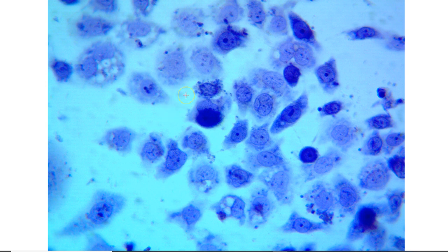Here's another similar slide that contains a different cell line and was treated with some particular drug, and you can see all different types of things happening in this one as well. So you see some cells, these are large cells in general. They have nice membranes, they have nuclei inside. Now some of those nuclei are large and some are small.